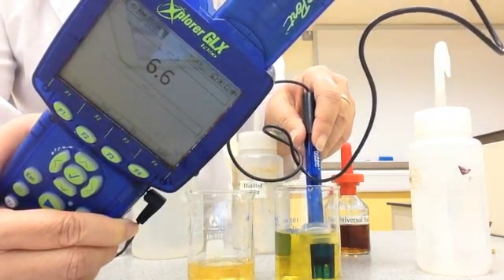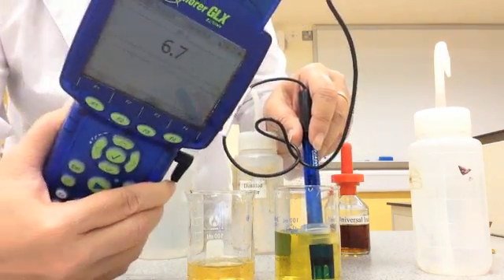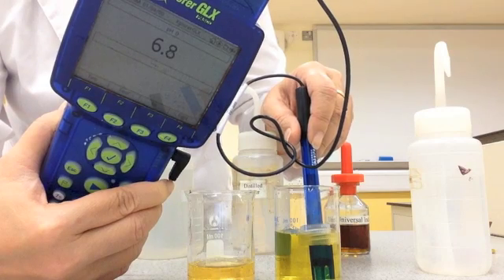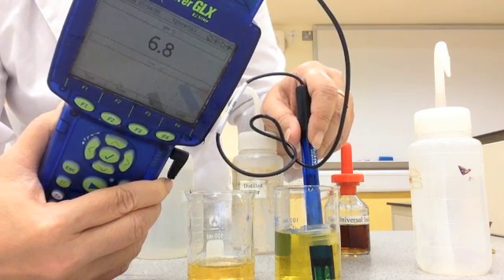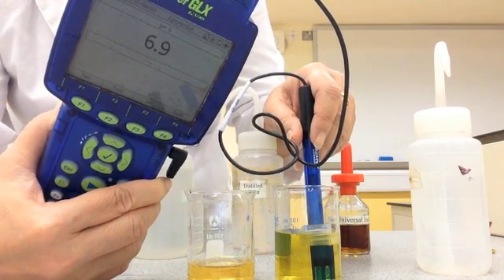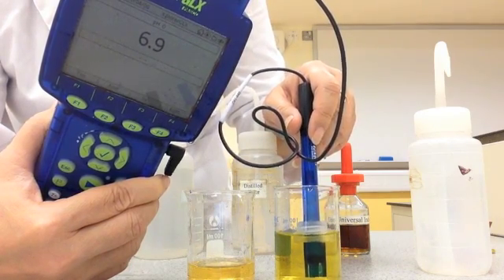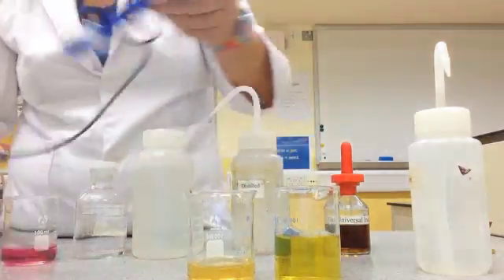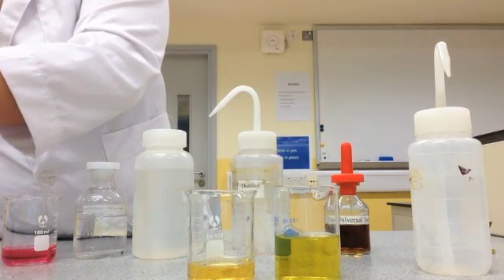Now I'm testing the substances that appeared neutral. The pH meter is settling... 6.7... 6.8... 6.9 — so this one is very close to being neutral at around 6.9. Let me rinse the probe and test the other one just to be sure.